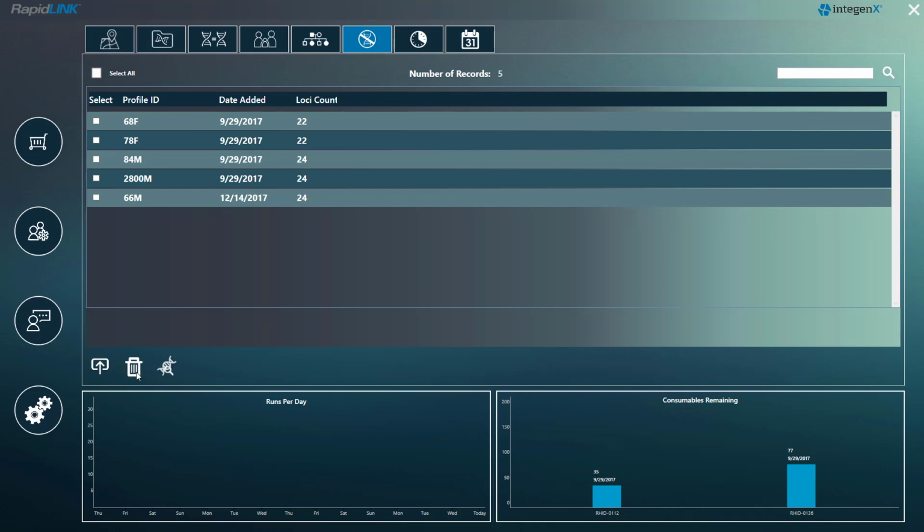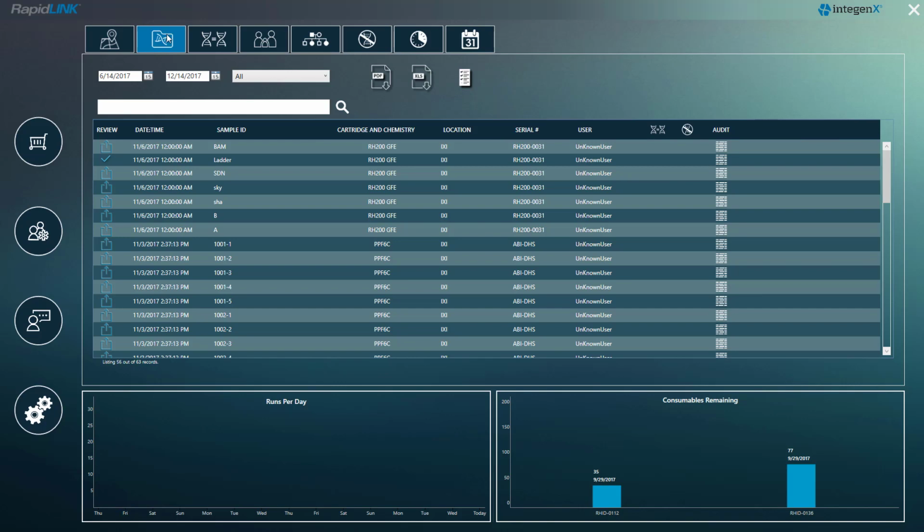One easy way to keep the database up to date is to require instrument operators to enroll their profiles as part of operator training. Plus, once you have the operators enrolled, their swabs could be used as positive controls to check system performance. That's all there is to setting up the elimination database. Let's now move to the Summary tab and see what it looks like when there is a contamination.